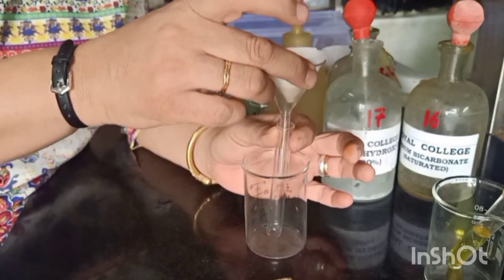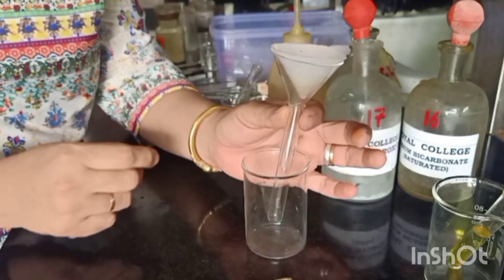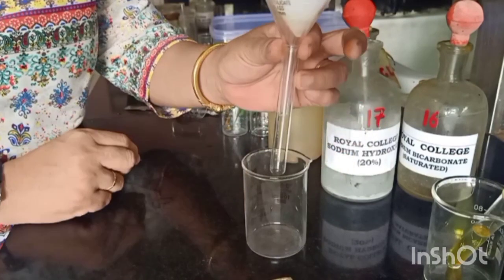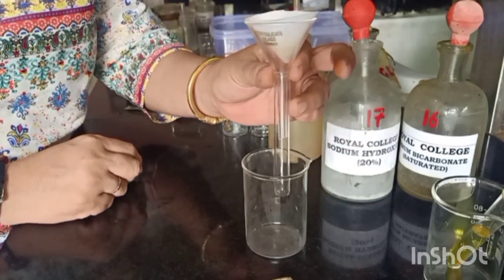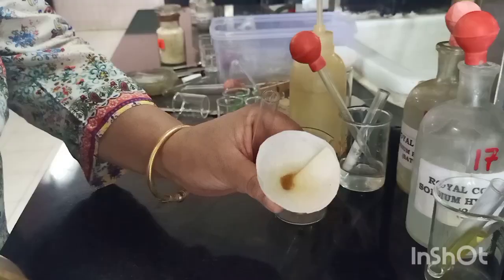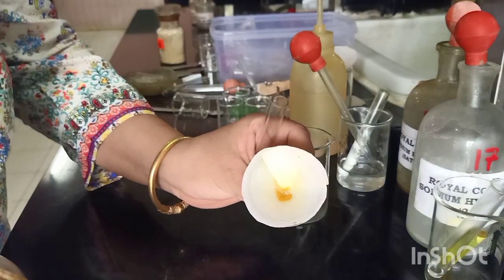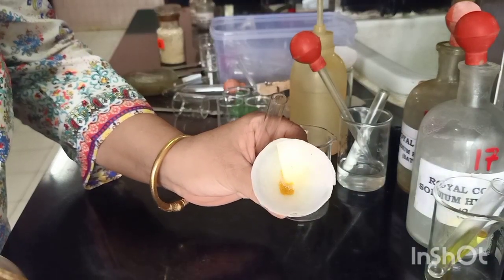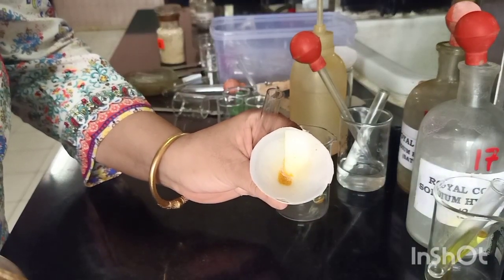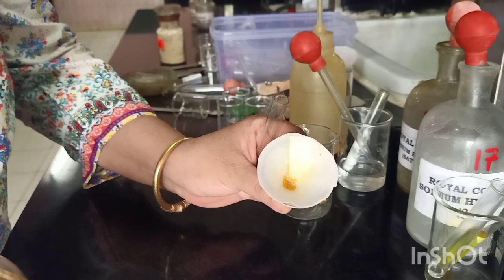Let's filter this and check the filtrate for re-precipitation. We'll just wait for the filtrate to come down. This is now the residue after filtration. We have completed the washing after the test for phenol.